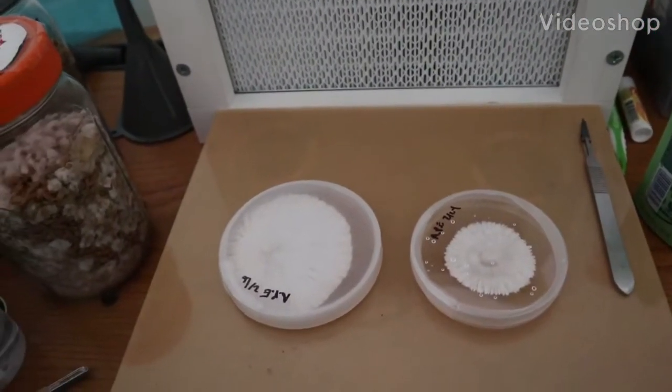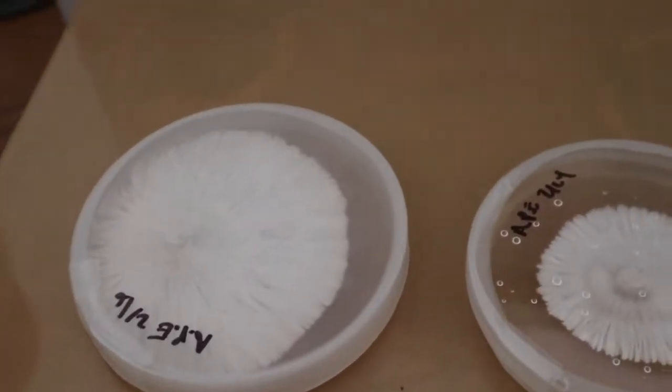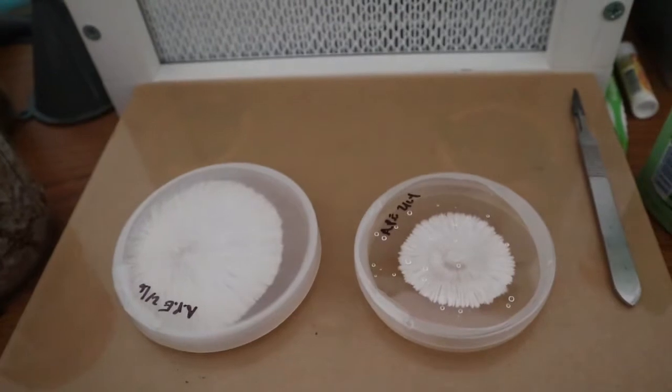Hello everyone, my name is Arden47 and in this video I'll be going over polypropylene dishes versus disposable ones, the pros and the cons.